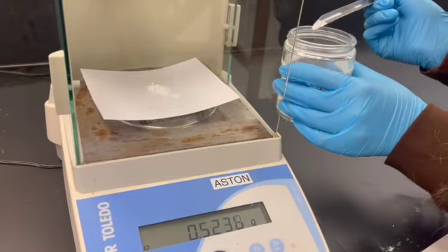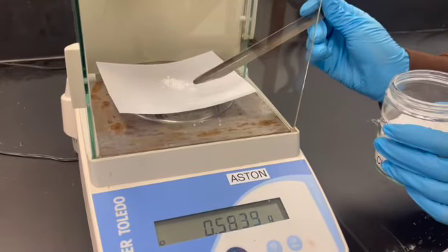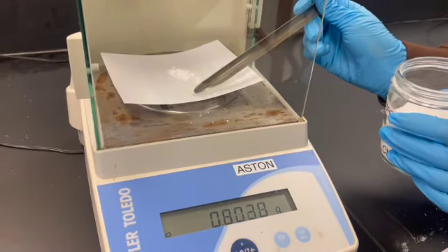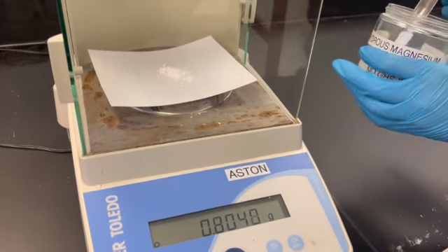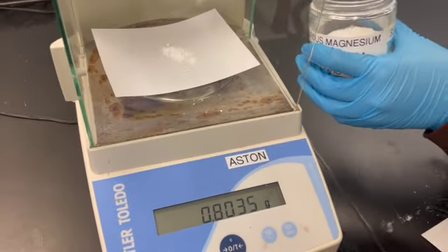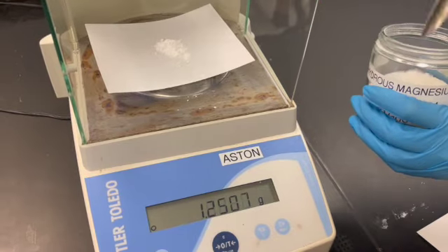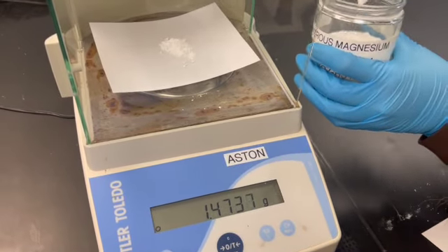We are getting 3 grams of magnesium sulfate. It has to be exact because we are going to funnel it in.